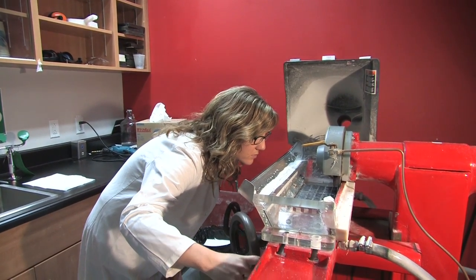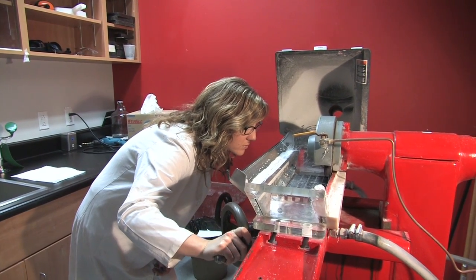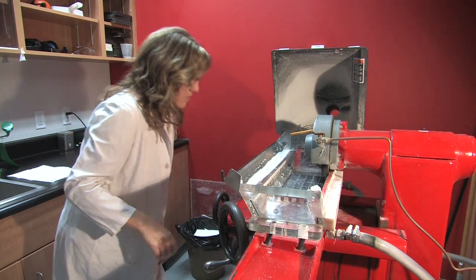The process of cutting involves removing a one millimeter strip through the middle of each ridge on the plate and discarding the material in between.